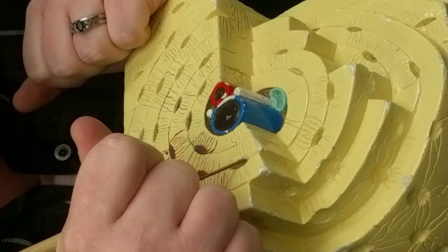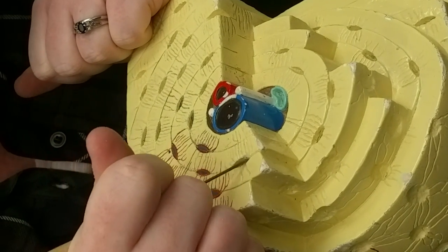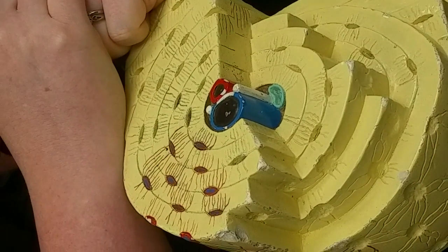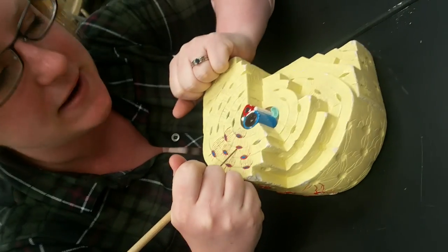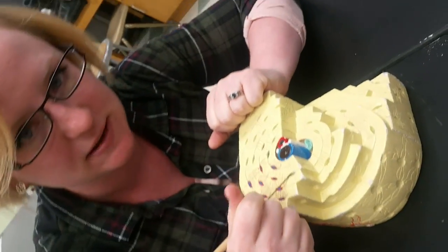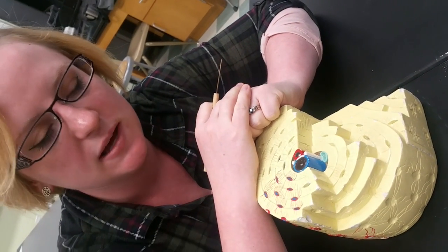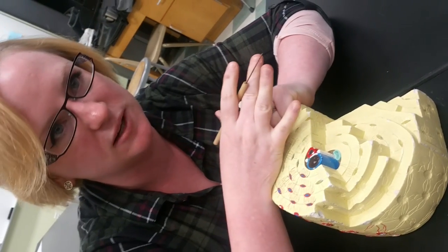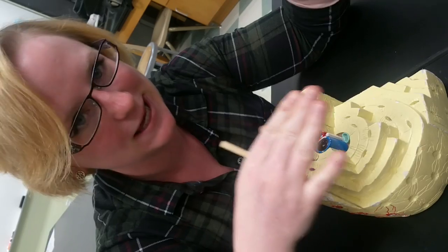Now, there are little crevices that they live in, and they also have a name. So these little crevices are referred to as lacunae, L-A-C-U-N-A-E, lacuna. And I always say that the cell lives in a lake, right? The osteocytes live in a little lake, and that lake is just referred to as a lacuna. And the reason why I think about lake and lacuna is that actually lacuna means lake, okay? So I always think lac, lake, and that helps me.